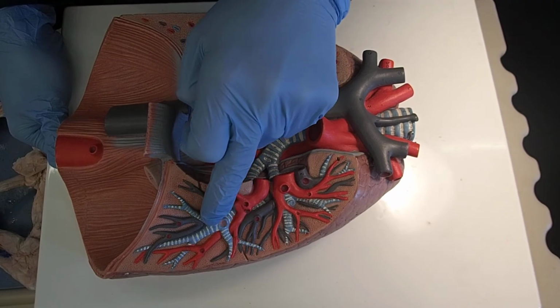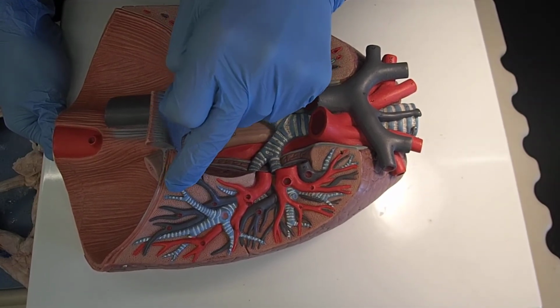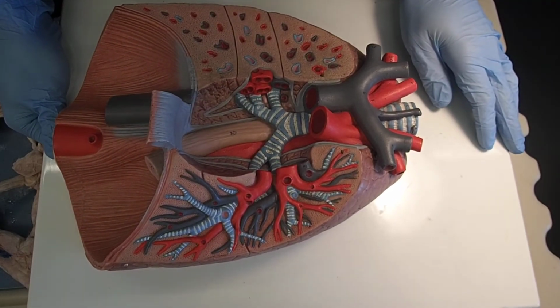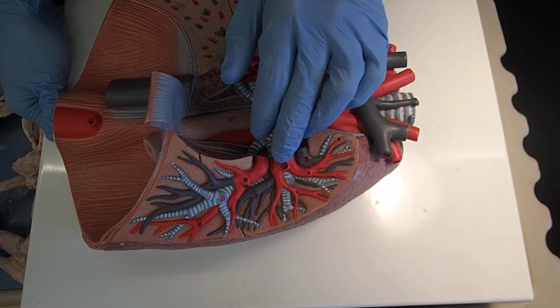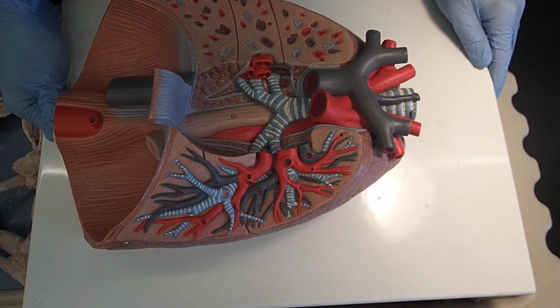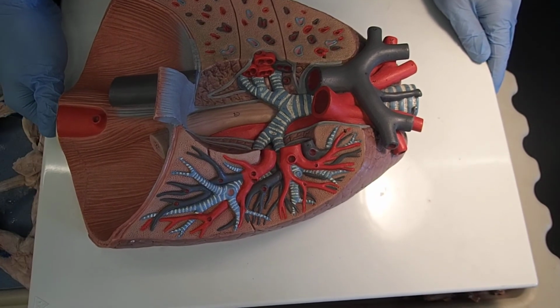Those secondary bronchi then branch again into my tertiary bronchi, and then ultimately I have bronchioles being the very last levels of branching. Those then go to the sac-like structures, the alveoli, and you can also see that we have blood vessels coming in and out to exchange that oxygen-rich and oxygen-poor blood, to reoxygenate that blood.